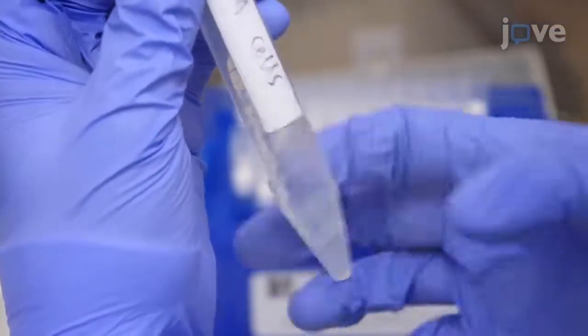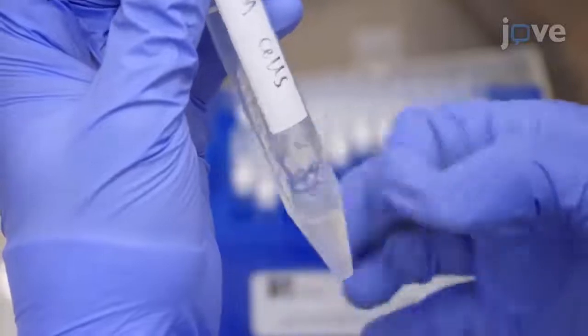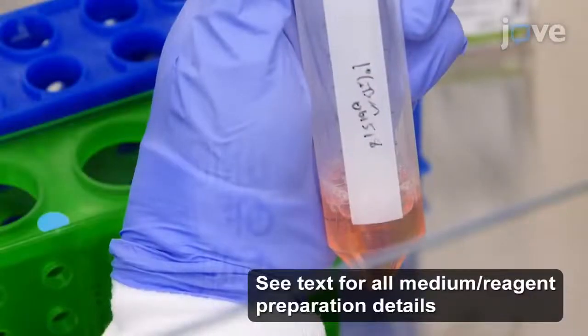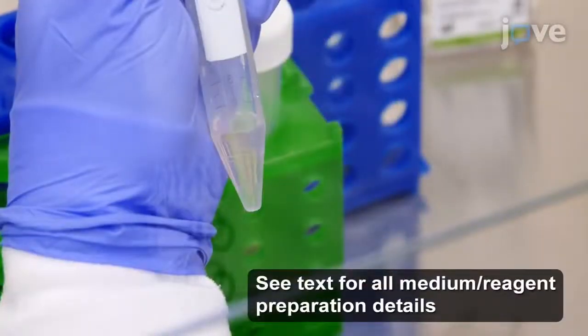After 5 minutes at room temperature, agitate the tube with gentle tapping and arrest the enzymatic reaction with 4 milliliters of complete medium.